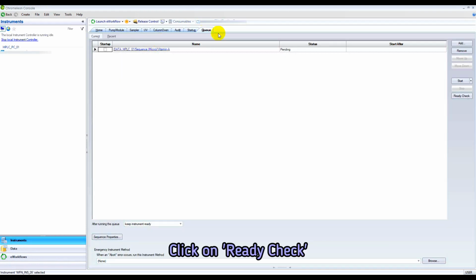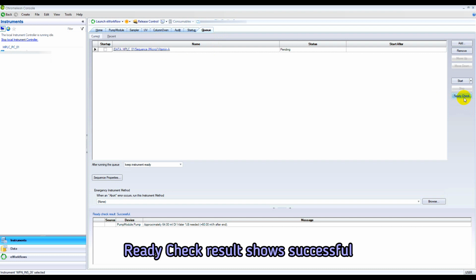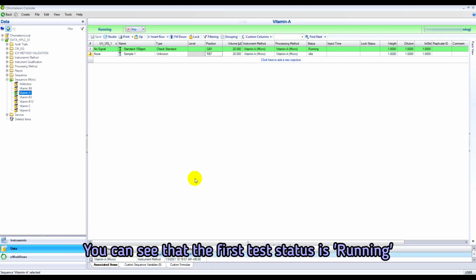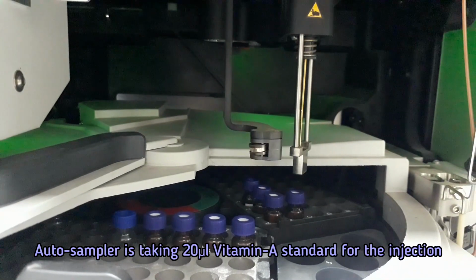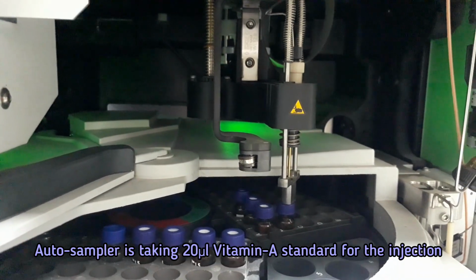Go to the queue and click on Ready Check. If the Ready Check result shows successful, then click on Start to start the instrumental analysis of Vitamin A. You can see first test status is running. Auto sampler is taking 20 microliter Vitamin A standard for the injection.